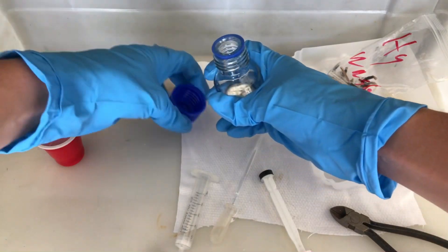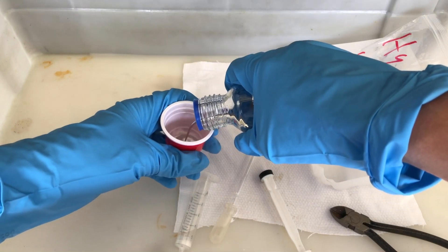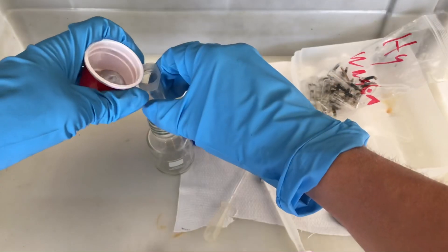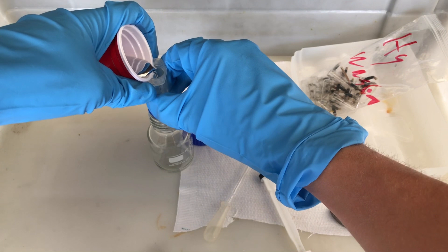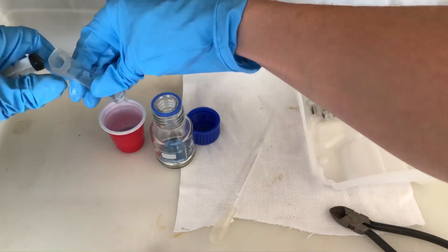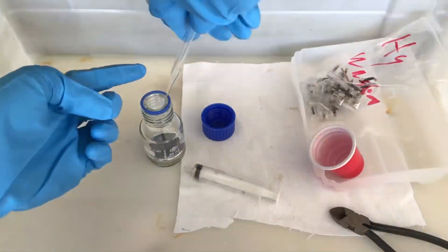The cotton captures all sorts of contaminants floating around in the mercury. You fill the mercury in there and afterwards use the plunger to force it through the cotton. Despite its weight, the high surface tension of mercury keeps it from flowing through the cotton by itself. While doing this, you should still carefully transfer the mercury to the syringe, because as I already said, it likes to splash. And if you rush, the mercury is definitely going to splash everywhere.